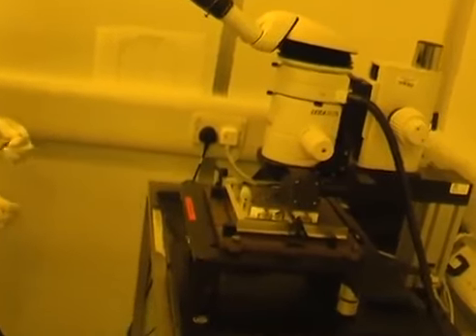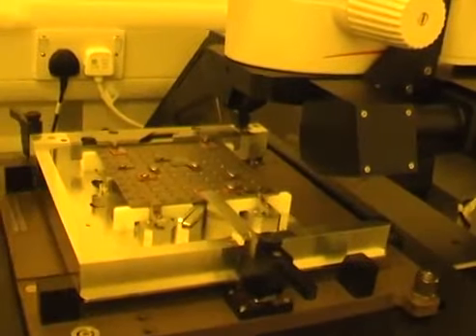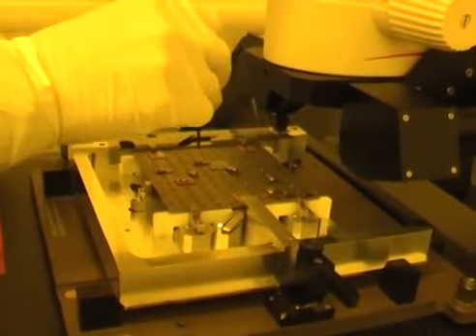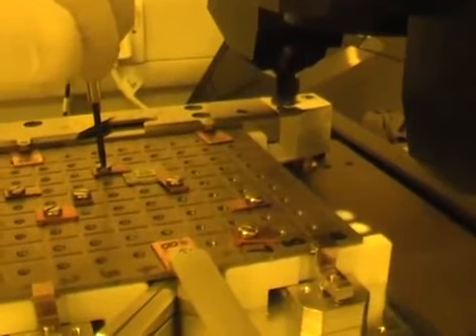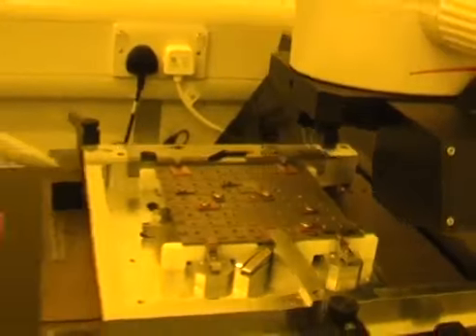Okay, it's a lot better than it was. I need to go back the other direction slightly. What I'm noticing is that that clamp's a little bit loose, and the slightest nudge moves it a long way. So I'm going to tighten this clamp just a little bit, and then just go back and recheck.